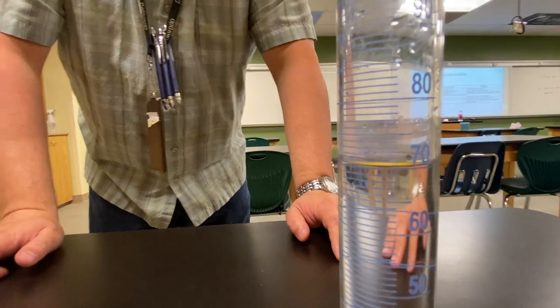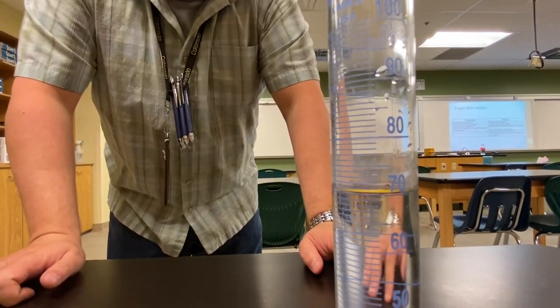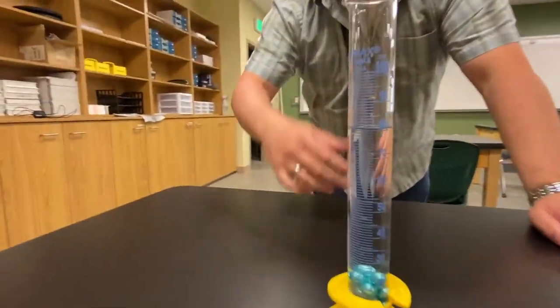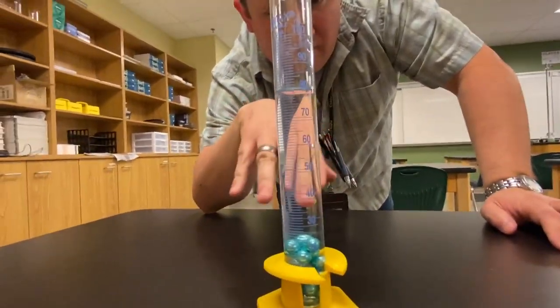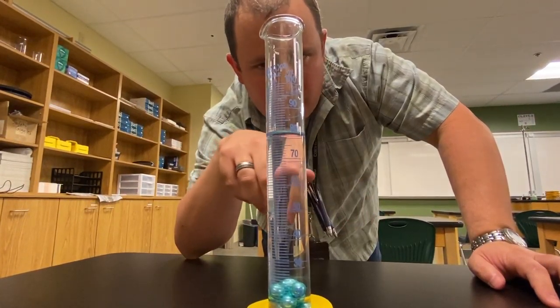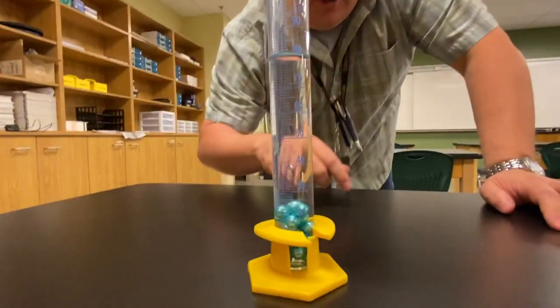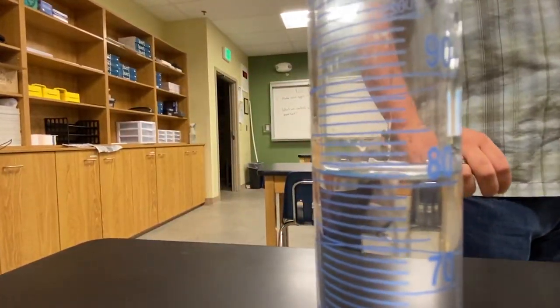We're going to start right here. This is an empty graduated cylinder that has no pearls in it. You need to measure exactly how much. Remember, review your Chapter 3, Lesson 1 information on how to read a graduated cylinder. Over here I've got a container that is now full of pearls. They both have the same starting water level, so since they have the same starting water level, any change should be from our pearls by themselves. There are 20 pearls in here, so go ahead and read exactly how much we have in terms of volume on that.